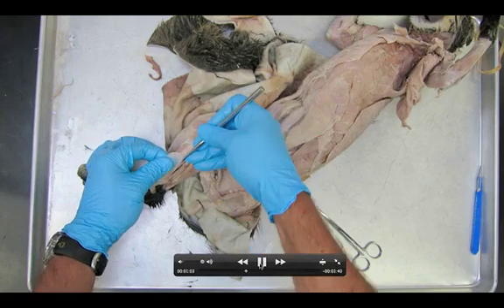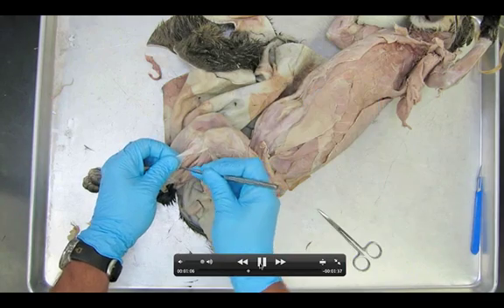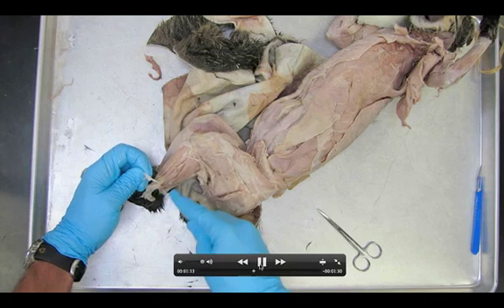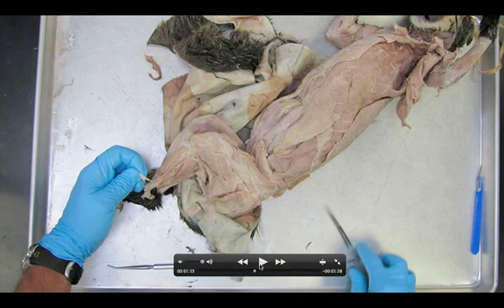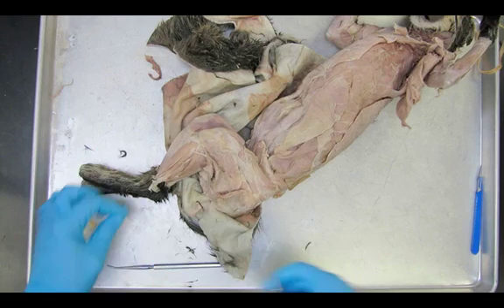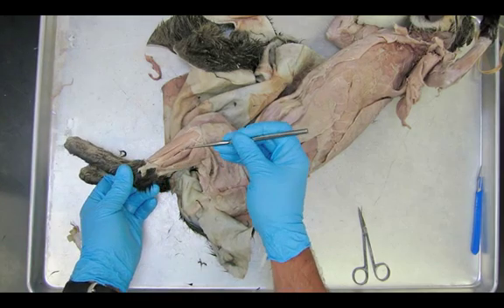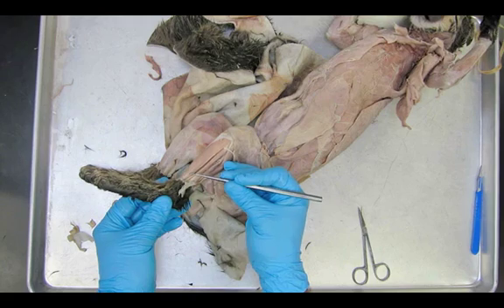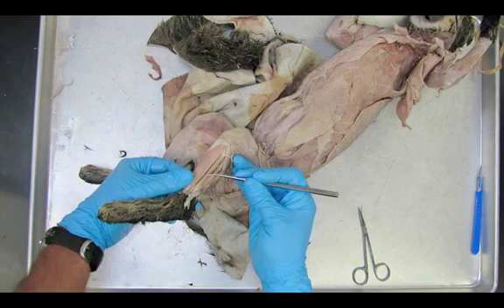We've got a little bit more of this connective tissue to remove. This should hopefully be the last layer that we remove. We'll just highlight the differences between these two. You can definitely see this is a muscle, this is a muscle, this is a muscle. And this is the same muscle that we've seen before, the tibialis anterior. But you're going to find a very, very faint line that you're going to be able to tease apart here. This is super easy to miss. Now let's see if we can discover this little faint line that is actually separating the tibialis anterior from the extensor digitorum longus.